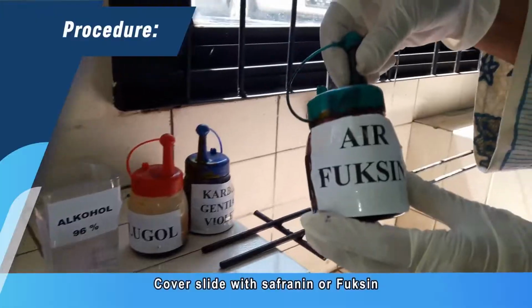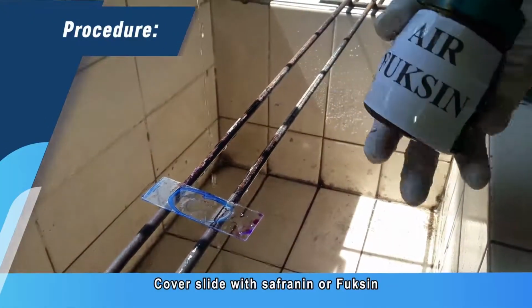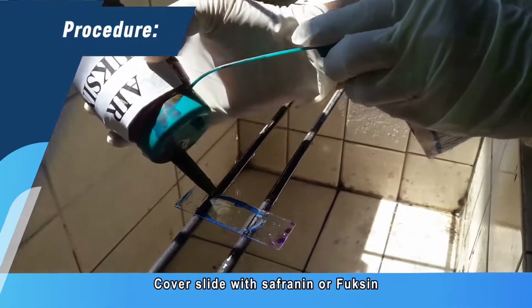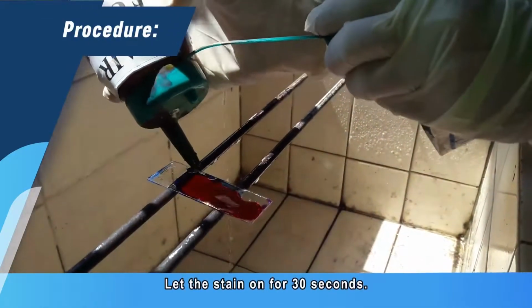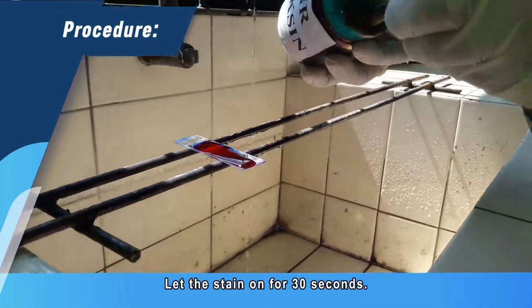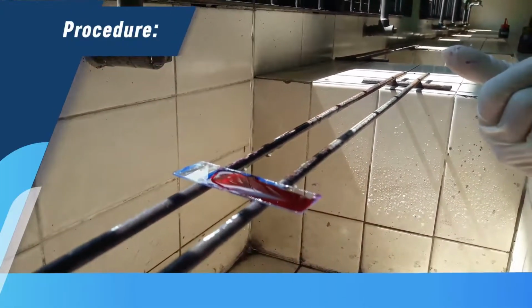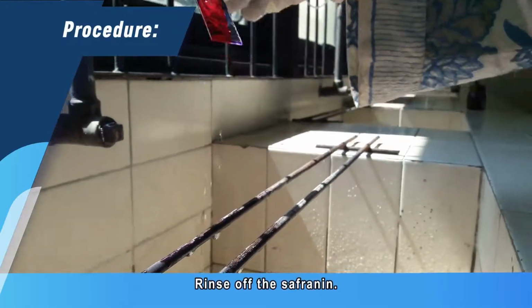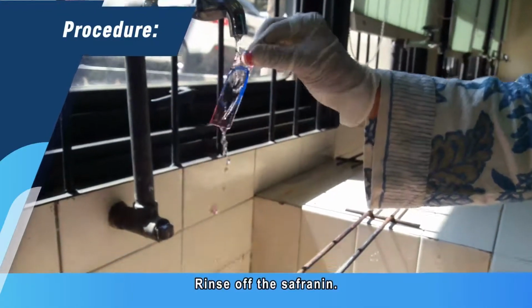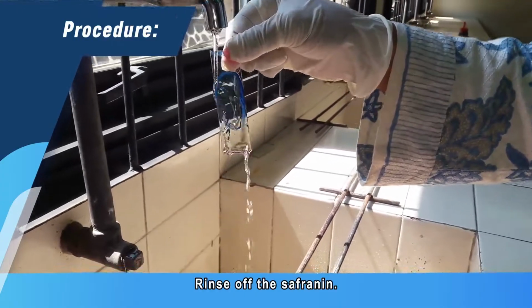Now cover the slide with safranine or fuchsin as the counterstain, and let the stain sit for 30 seconds. It's really important that you shake off the last water before this step so the stain doesn't get diluted. After 30 seconds, rinse off the safranine. Shake off the excess water.